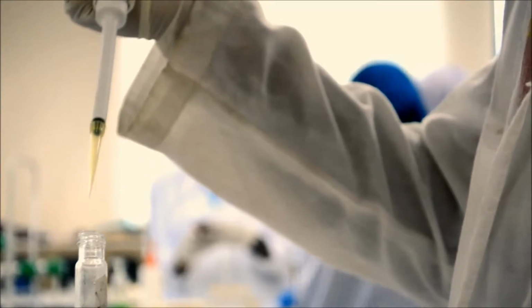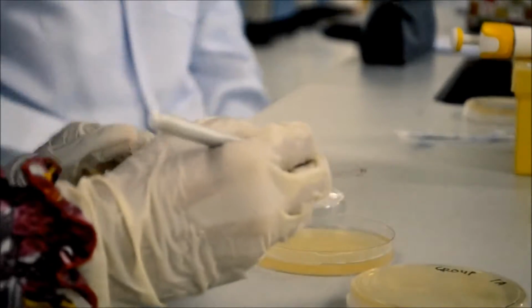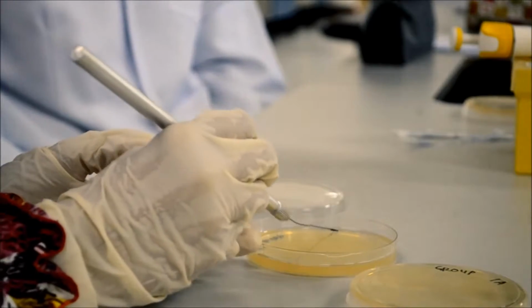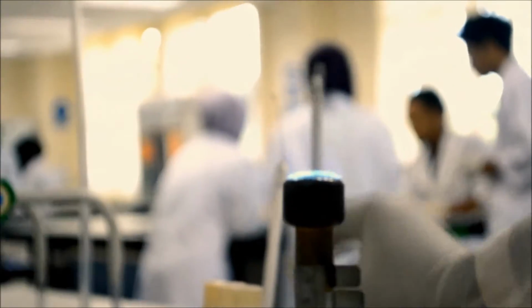In the streak plate method, the bacterial mixture is transferred to an agar plate using an inoculating loop and then streaked out over the surface. The key principle is that by streaking, a dilution gradient is established on the surface of the agar plate. The aseptic technique is very important to prevent contamination of the culture from foreign bacteria inherent in the environment.